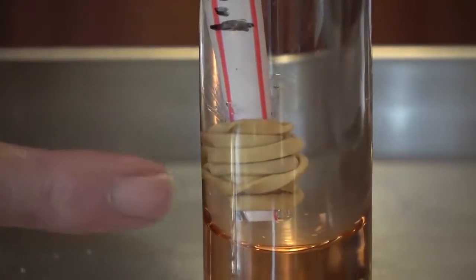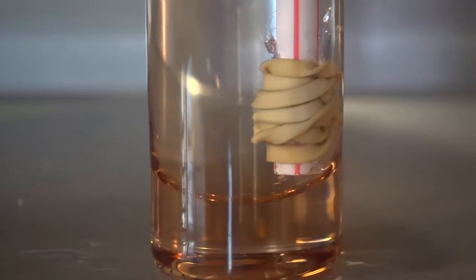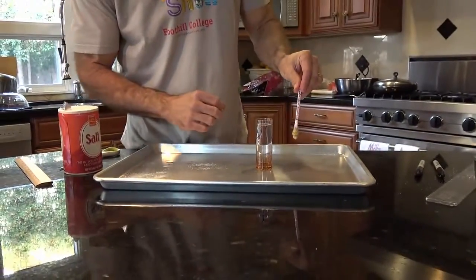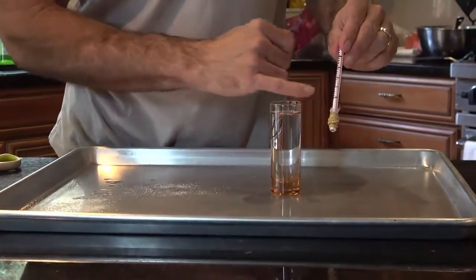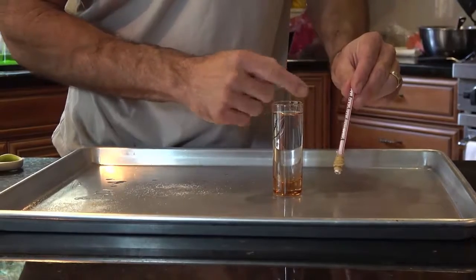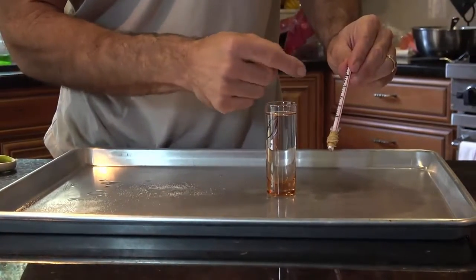And this is floating now. It's not quite touching the bottom. So I think I'm good. I'm going to leave it just like that. You want it to be very close to the bottom, but not touching it. So I have just the right amount of salt in there, and I'm going to stop, and I'm going to let this dry a little bit so that these markings are still there. If they disappeared, just get your marker out after it dries off and redo them.